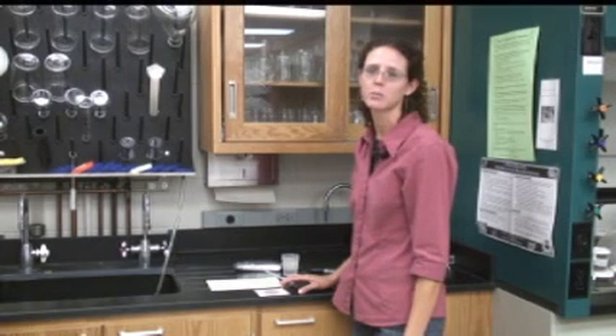These will develop at room temperature in approximately 48 to 72 hours, depending on how warm it is. You'll put it in a plastic bag to prevent it from drying out, and then put that plastic bag somewhere warm away from direct sunlight — the top of the refrigerator works fairly well. If you have an incubator, you can simply set the plates in the incubator and wait 24 hours, then read your results. The incubator should be set at warm body temperature, approximately 90 to 95 degrees Fahrenheit.